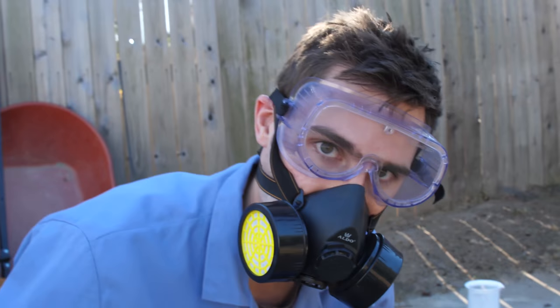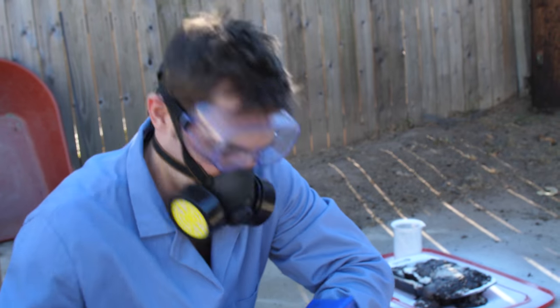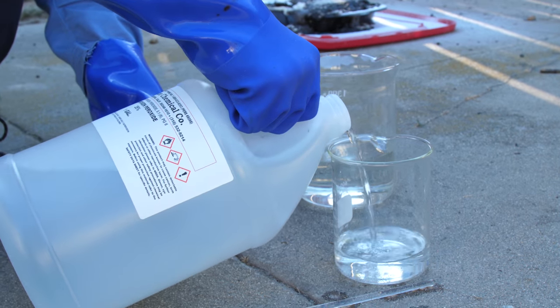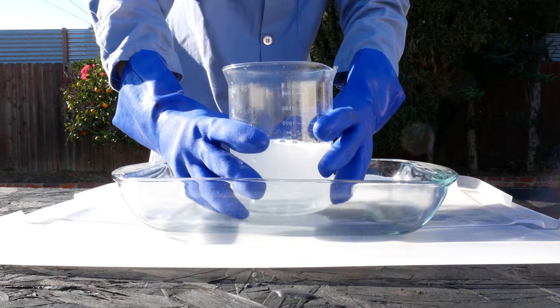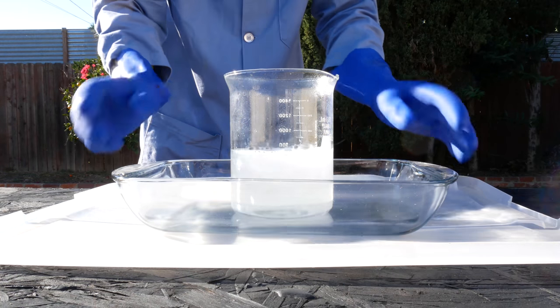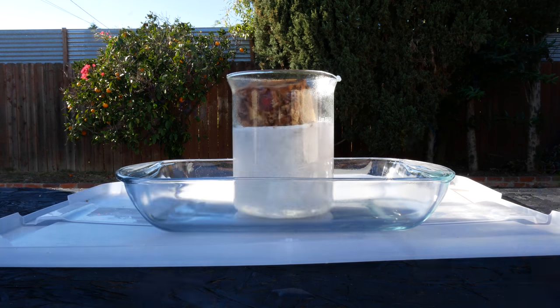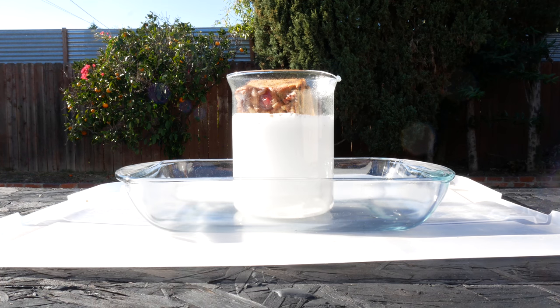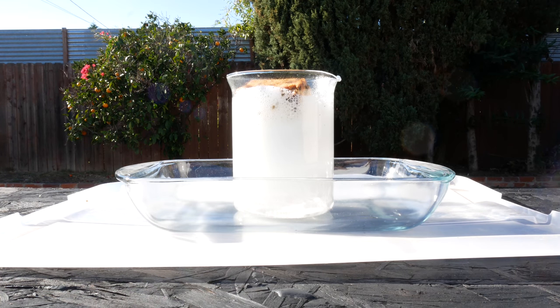The mask is there because we now have fumes coming back, and it's just not good to breathe in. Three, two, one — go! Them piranhas are hungry! Oh, goodbye fruitcake!